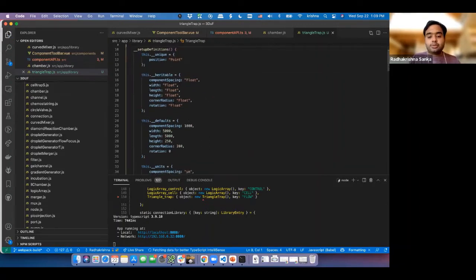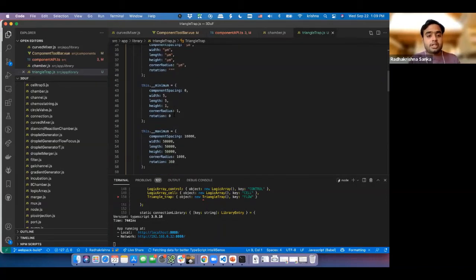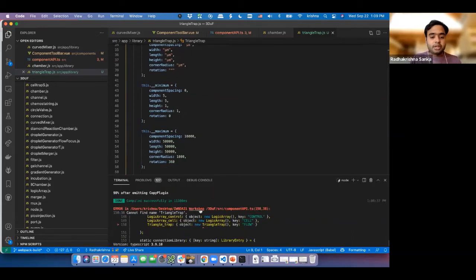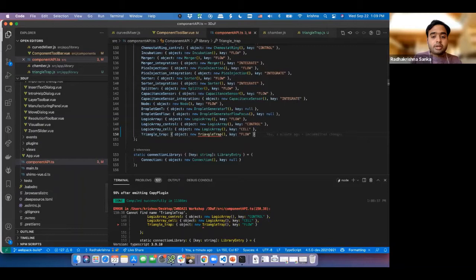Then I need to modify all these things to make it specific to triangle trap. And then I'm going to need some float data and all these things. But for now, it doesn't matter what it is here. So let's see what happens if we save this. We need to go back to the component API, to tell it where triangle trap is coming from.